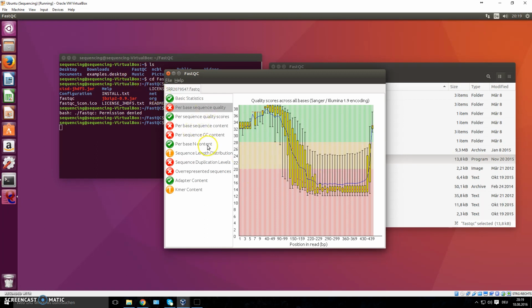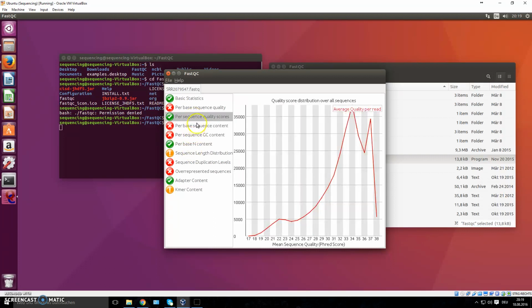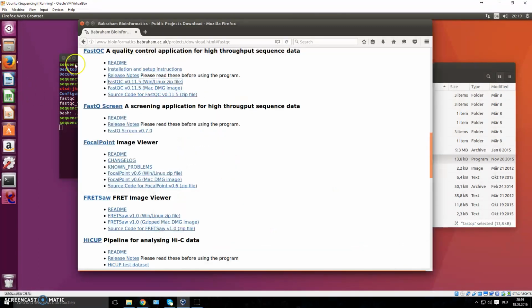If you want to learn about all of these other things right here, the information you get, for instance, the per sequence quality score, which talks about everything, it gives you apparently a green check mark, although it looks so bad. You can look at this one here. This is the Phred score. And the Phred score is basically what you saw here as well. But the Phred score, you can Google it.